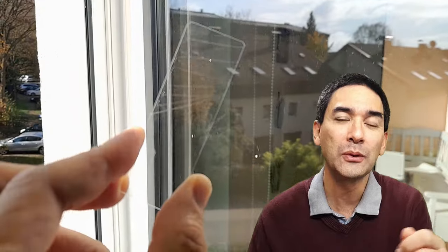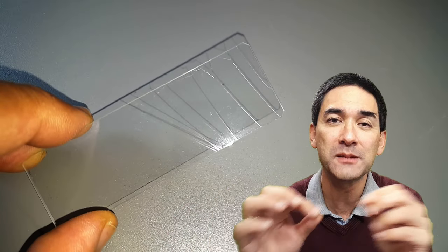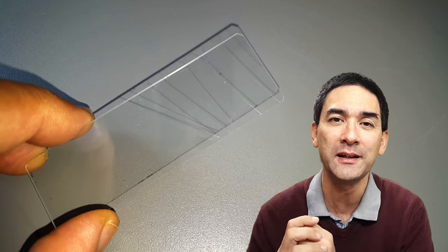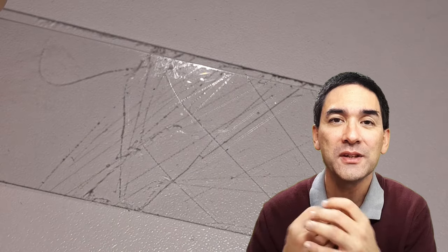I had to chase the spider away first but then I was able to collect a few of the spider's silk on the microscope slide and it is a very very sticky substance as we're just going to see in a minute.